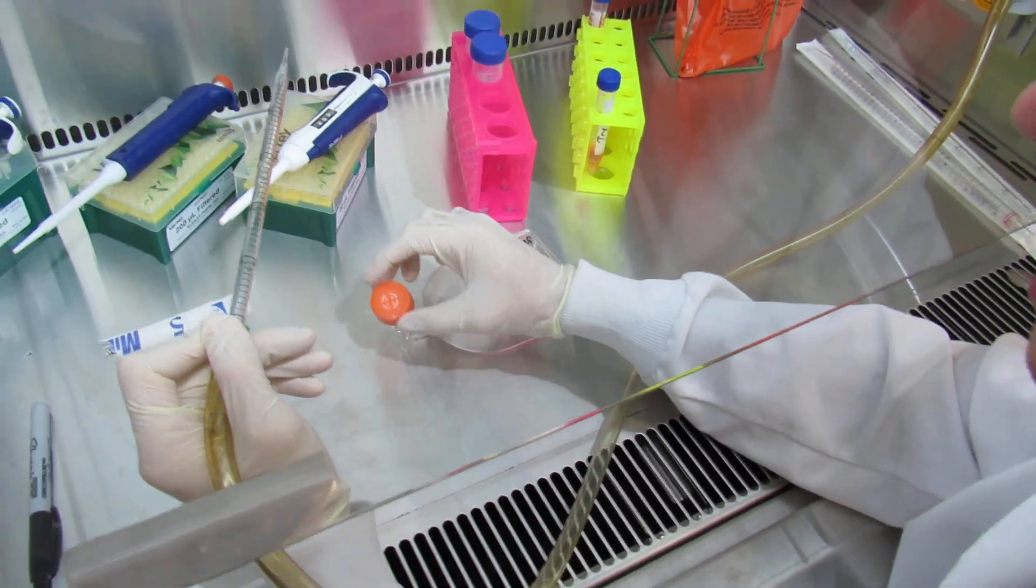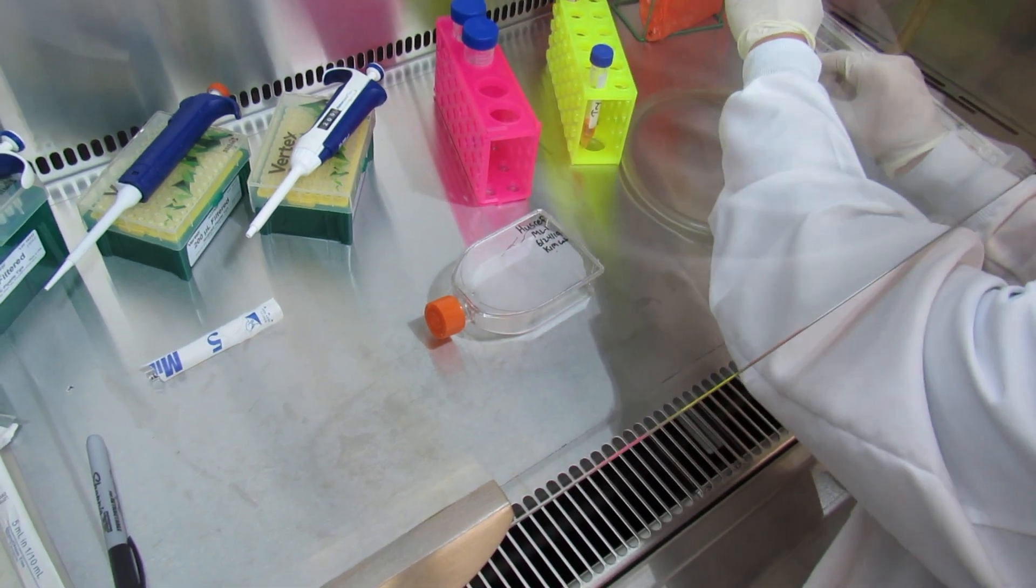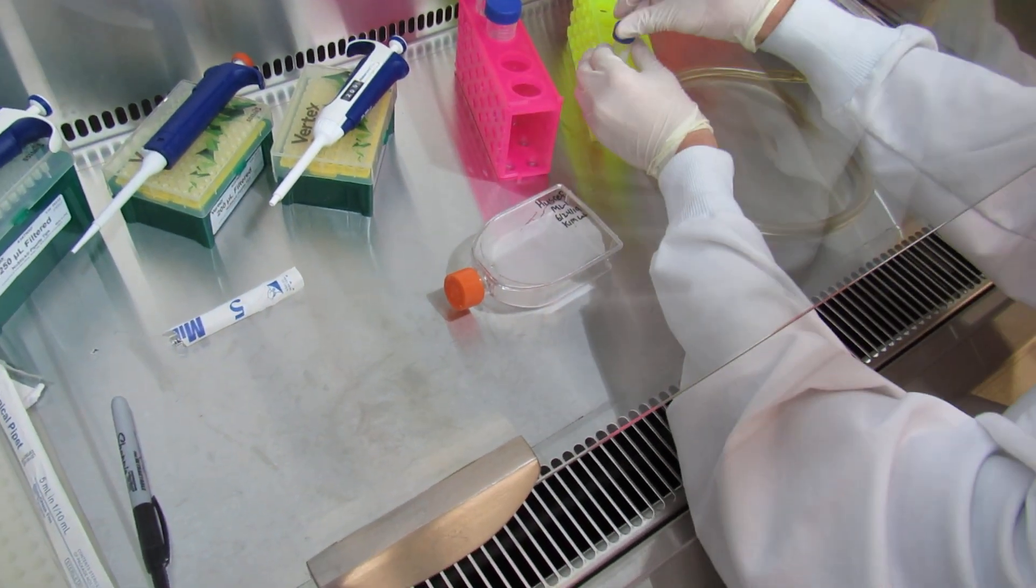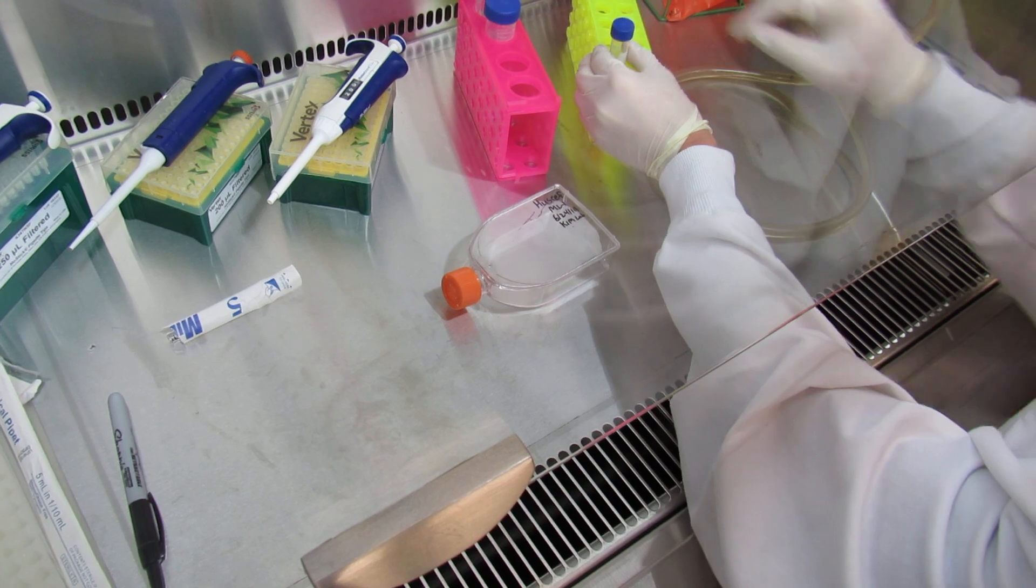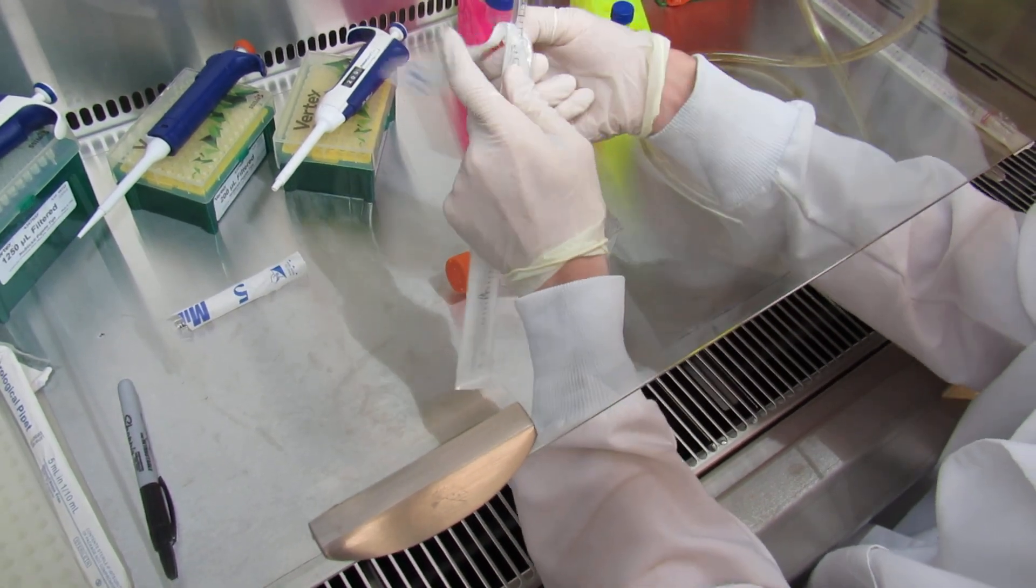And remember, once all the media has been removed from the flask, that your cells are going to begin drying out, so you want to work as quickly as you can with adding the trypsin as well as when you're doing the PBS to avoid as much drying as you can.